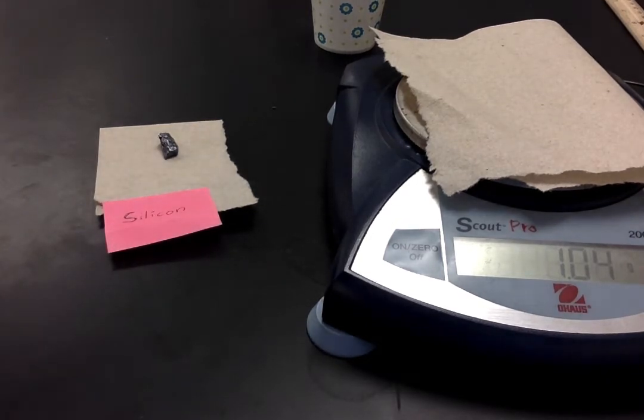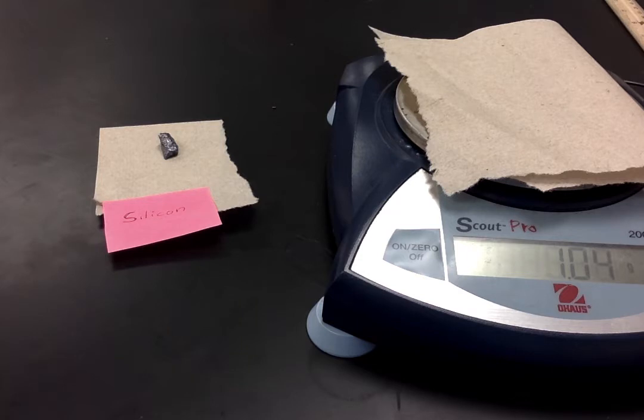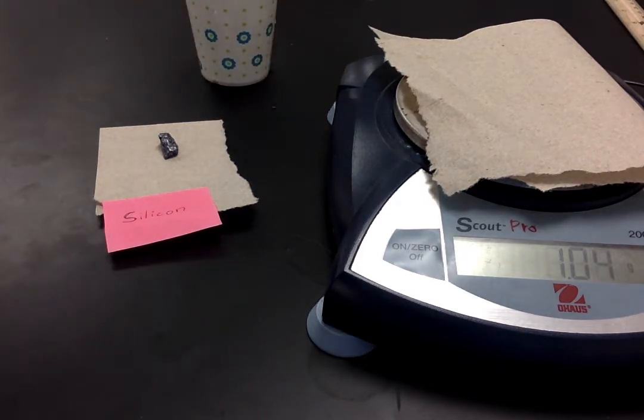We're going to get some water here. I'm just going to grab a little bit right here. It comes out of those sinks fast. Okay, so I got some water here. We'll use that in just a second.